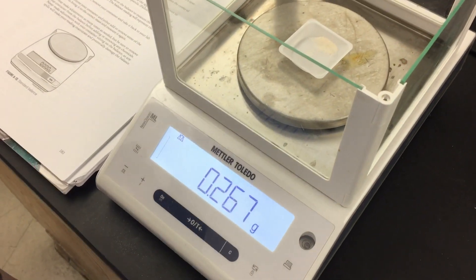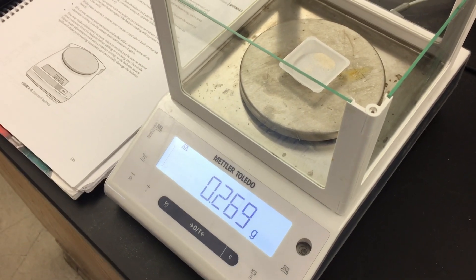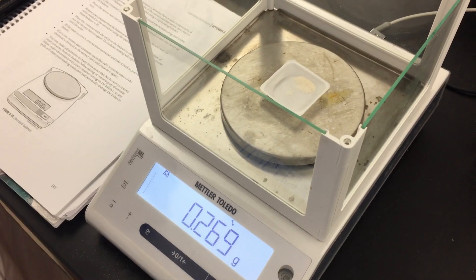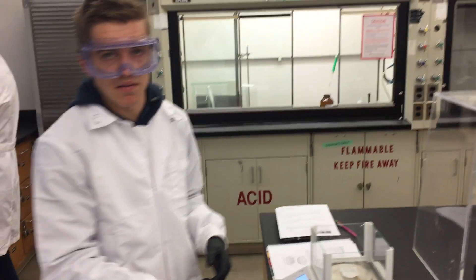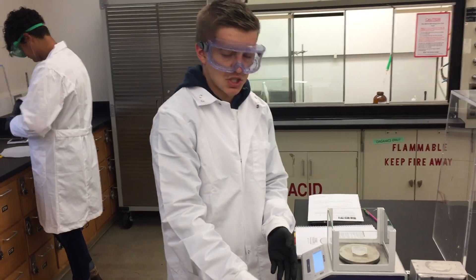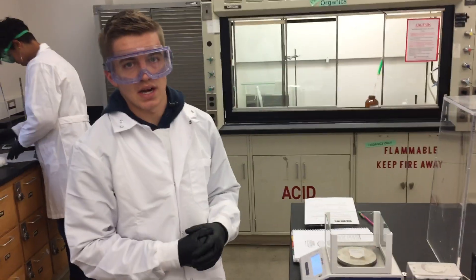We will get a reading, and whatever mass that we need, we will just make the needed adjustments. Every time we will remove it and make the changes until we get the desired mass.